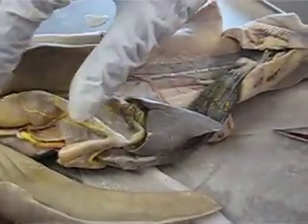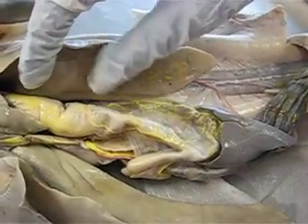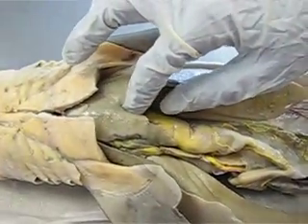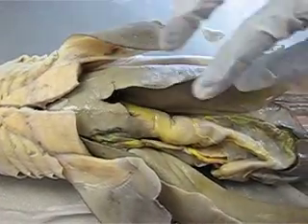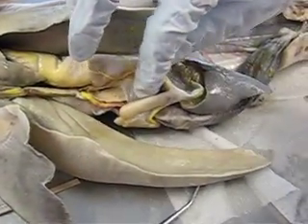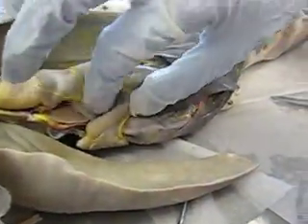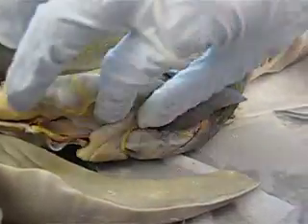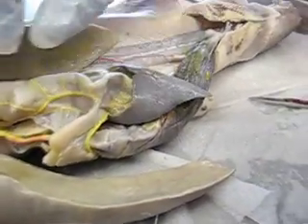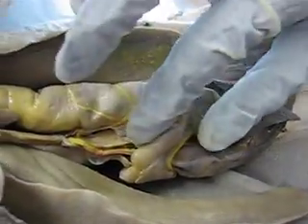We have our fundus, which is just the body of the stomach. Our cardiac region, which is the upper part of the stomach near the esophagus. The pyloric region, which is the lower part of the stomach near the pyloric sphincter, which is going to be where it joins with the small intestine — so that's going to be about right in here. The rugae are going to be the internal folds of the stomach.